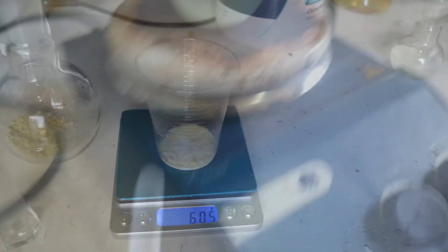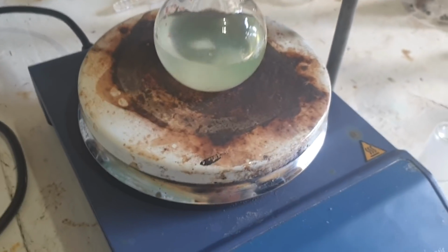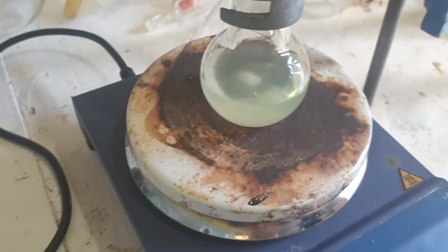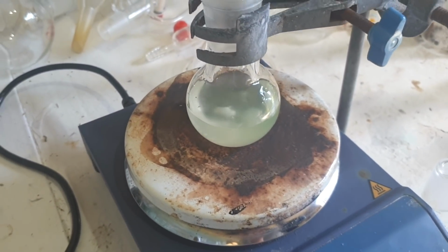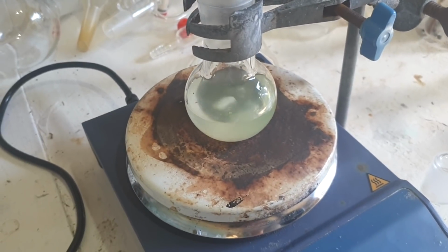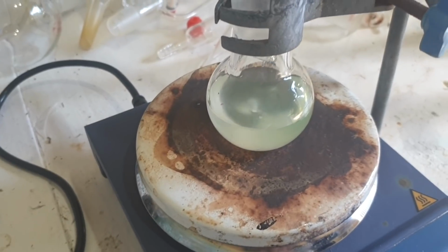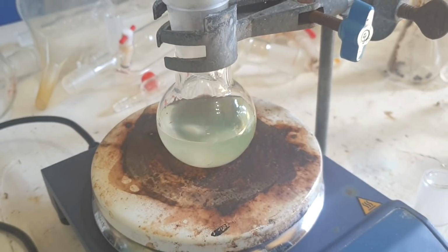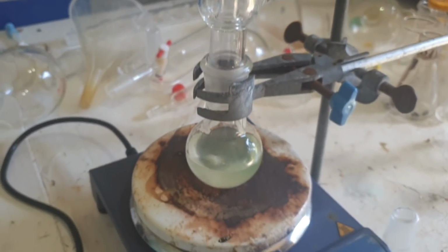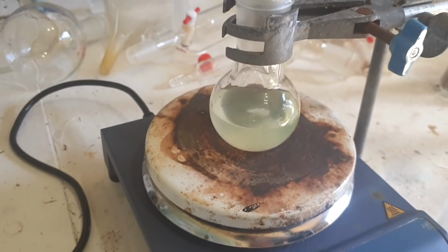Nearly a yellow, and I haven't even added the yellow stuff yet. It's just the sodium hydroxide and the ethanol. It gets this weird coloration. I've seen this before when adding sodium to this grade of ethanol. So there's something a little bit weird in it, but I don't think it'll harm it too much. It doesn't look very pretty when it's this horrible coloration already. Oh well. Got the condenser on, I've got to hook up the water, and add the rest of this solid. Well, add any of it, because I haven't added any of it yet, even though it looks like I have.